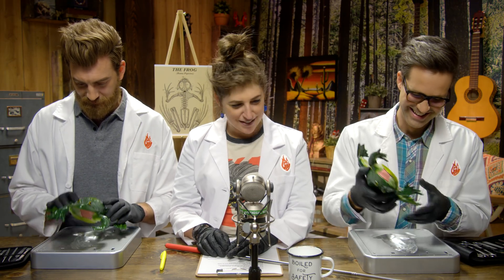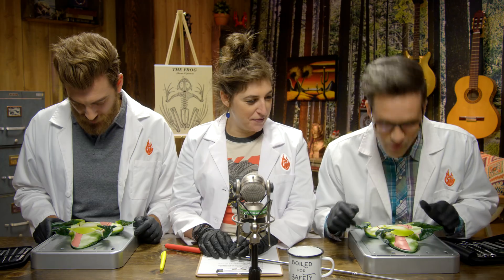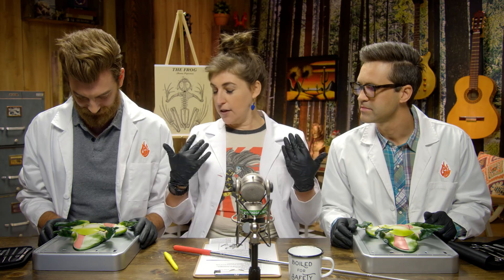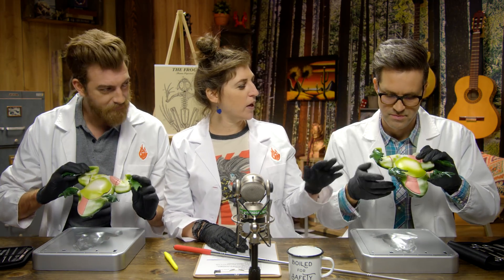All right, please turn Frandy and Charles over. This is their ventral side. Look at that — made in China. Like all frogs. First we're gonna look a little bit at the external anatomy of Frandy and Charles. Can you determine the sex of Frandy and Charles? Female, definitely. Oh, why do you say that? No penis — no freeness, as they call it on a frog.